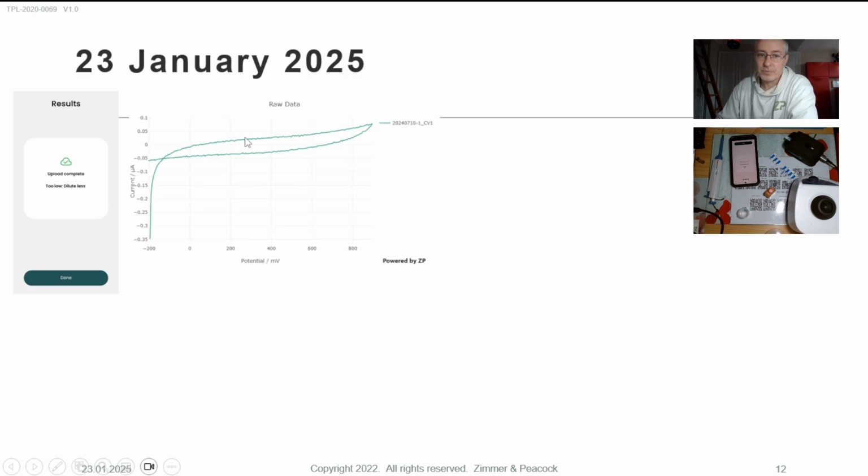So I look at this data, and if you've followed any of our videos, you'll see it in a minute when I do an analysis. We're looking for peak 1, which should be about here. We're looking for peak 2, which should be about here. And we're looking for peak 3, which should be about here. And I see none of those peaks. There's no capsaicin in this sample, but this is interesting because there'll be another retest in a minute and suddenly the capsaicin appears. But molecules appearing and disappearing is not some magical thing. The molecule is either there or it isn't there.